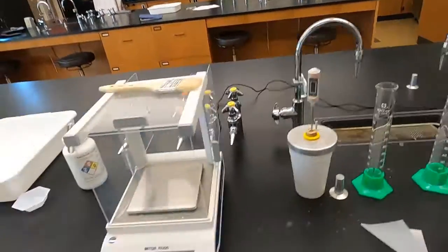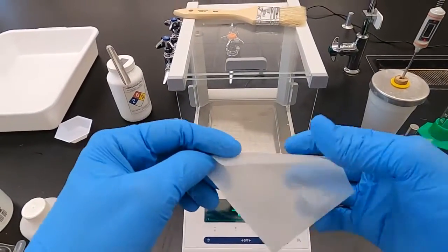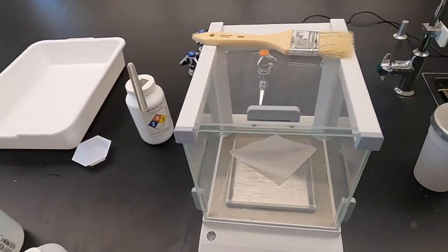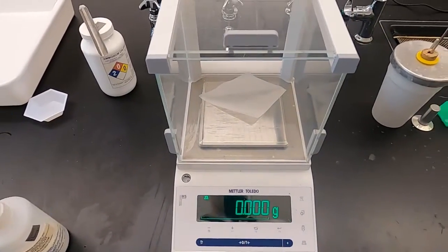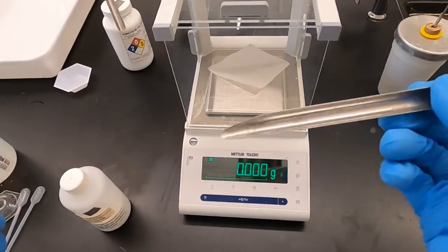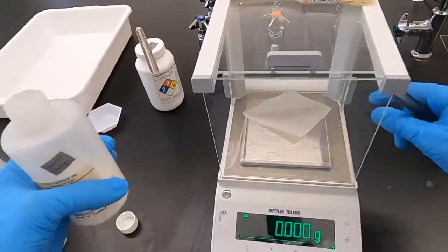We're going to weigh our 5 grams of calcium chloride now. Again, we have our weigh paper, brand new. Fold it, give a nice pour to this. Zero. We have a new scooper. And notice when I finished the last one, I didn't put the scooper back in.